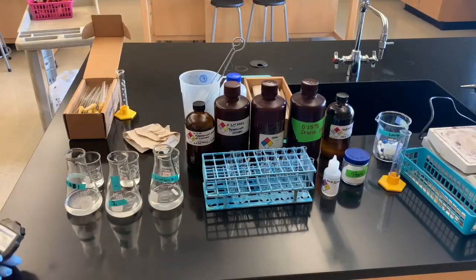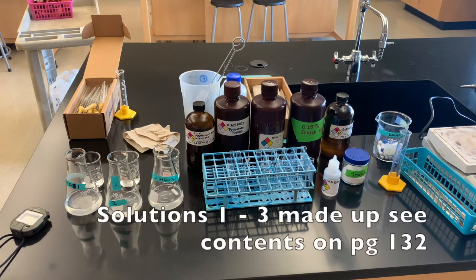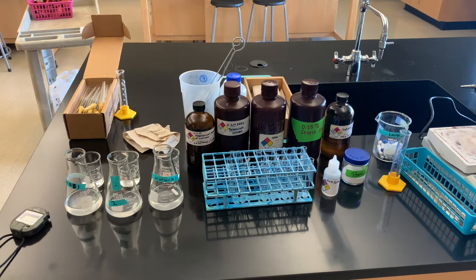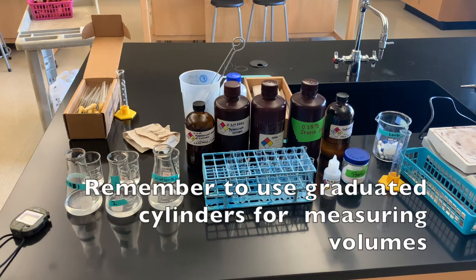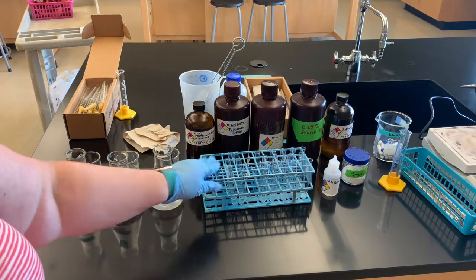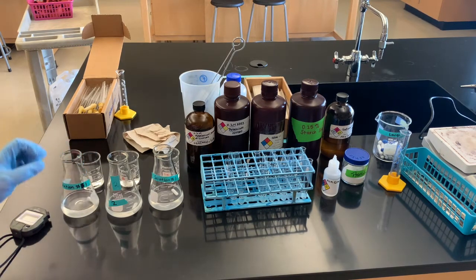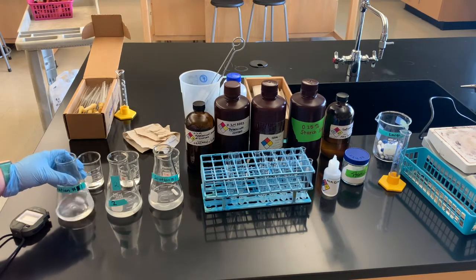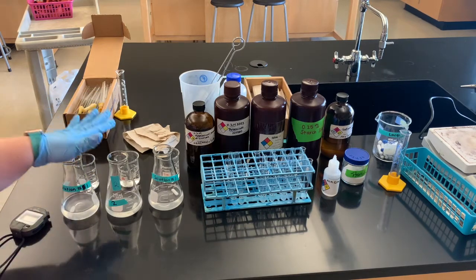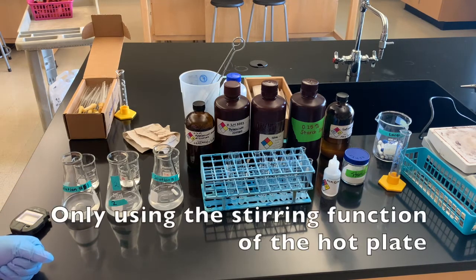Here we have the setup for the rates of chemical reactions lab. I already have all of my solutions mixed and ready to undergo the reaction. You can see all the chemicals sitting out here — I measured those out in graduated cylinders. I also have all of the aliquots in these little test tubes here, ready to go. We're going to set this up on a hot plate — we are not using the heating function, just the stirring function while the solution is reacting.